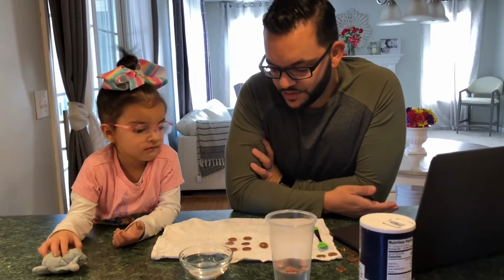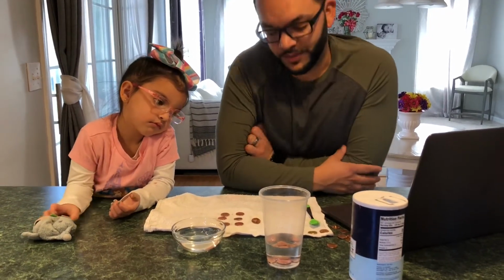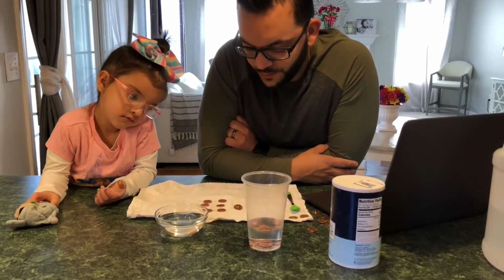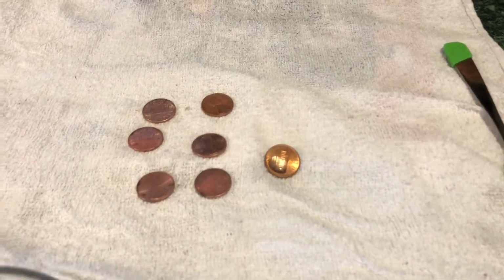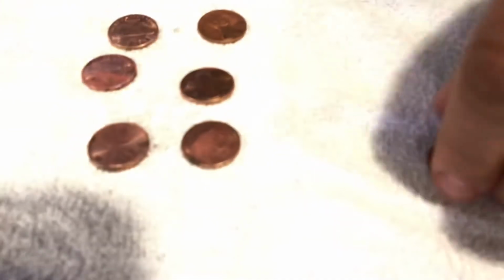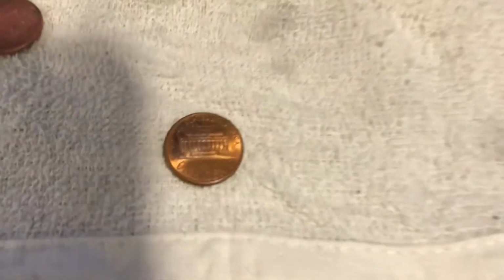So what should be happening is these should start to turn green because when they are not washed and exposed to air for long periods of time during the oxidation process, they should turn green, like the Statue of Liberty. But I don't necessarily see it happening. It's probably because we have to wait a longer period of time. Maybe they're not dirty enough. Well, this kind of happens. So you could look at this penny. I put a droplet on this penny, and you can see where it made a fancy design just on that penny.